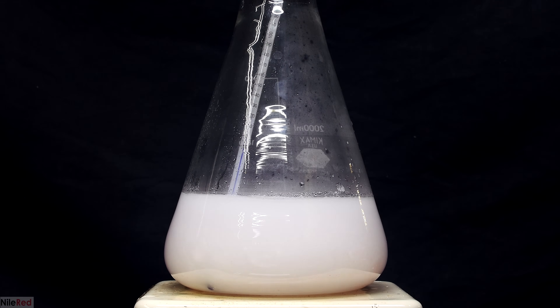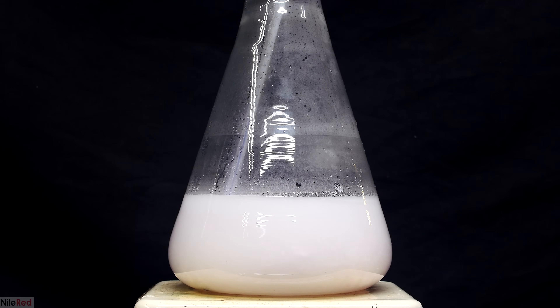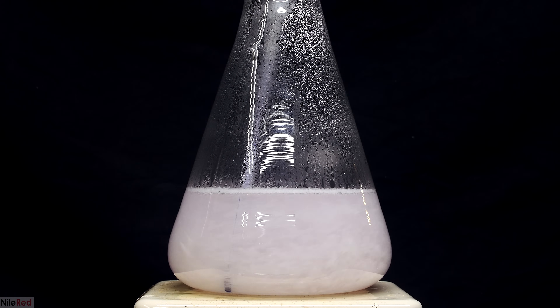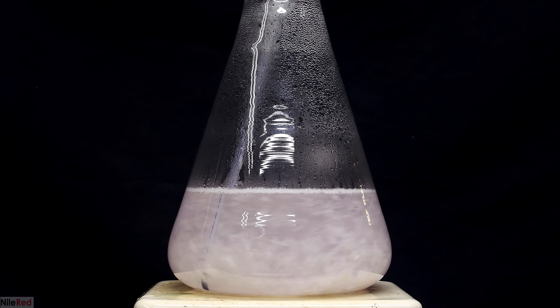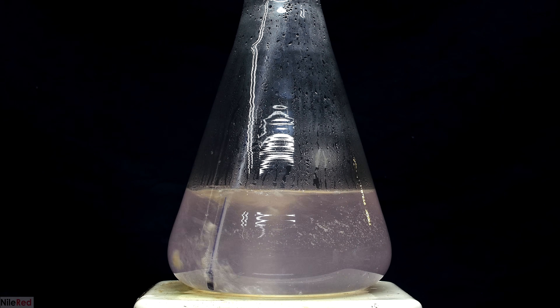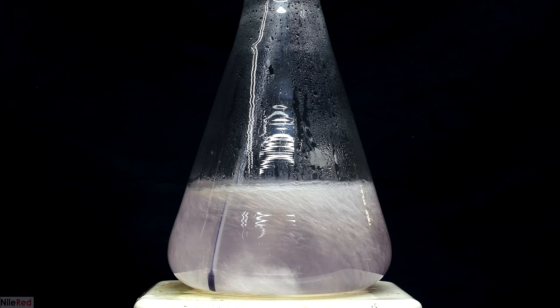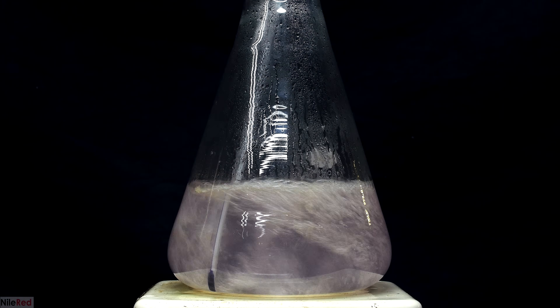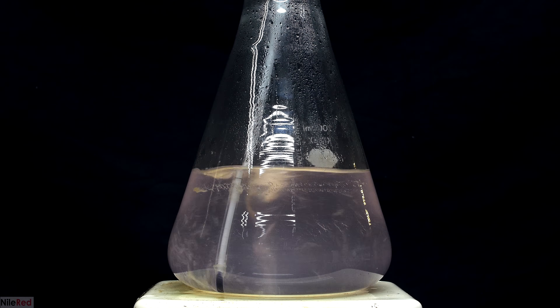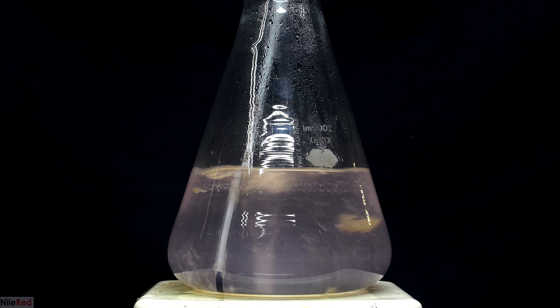I added a thermometer optionally just to see how close I was to the boiling point. As the water heats up more and more ASA should dissolve — ASA is practically insoluble in cold water but quite soluble in hot water. This allows us to dissolve the ASA in a hot solution, and as it cools down the solubility slowly decreases and the ASA will slowly crystallize out. We eventually reach the boiling point but it still looks a little bit cloudy, so I add a little more distilled water — room temperature, which is fine since the solution can just heat up again.